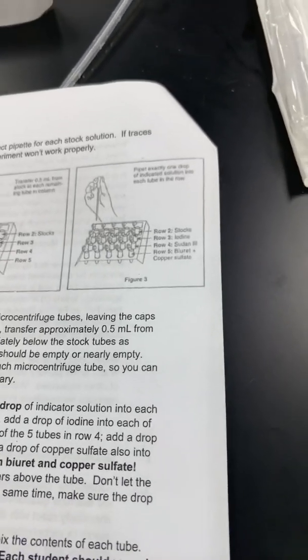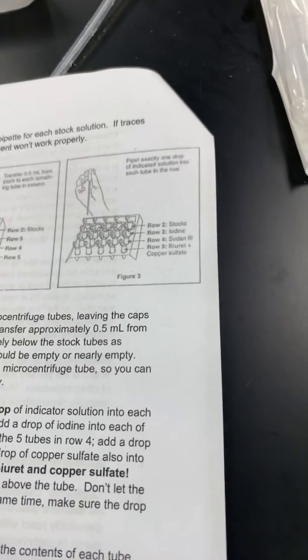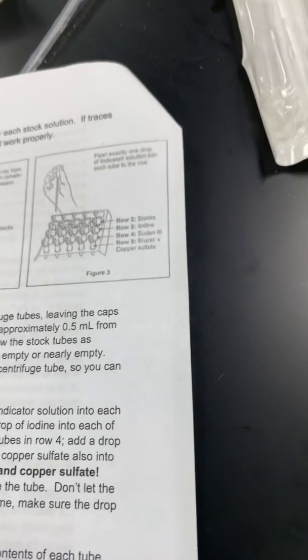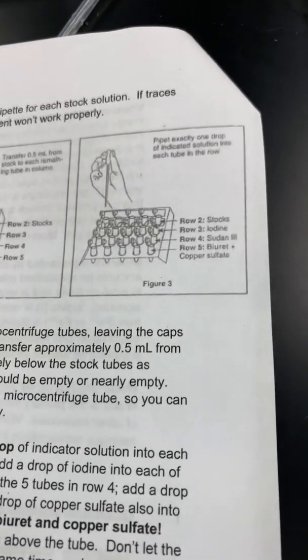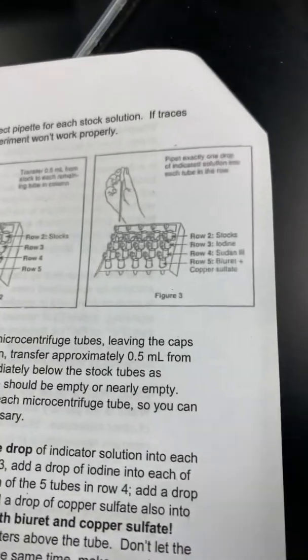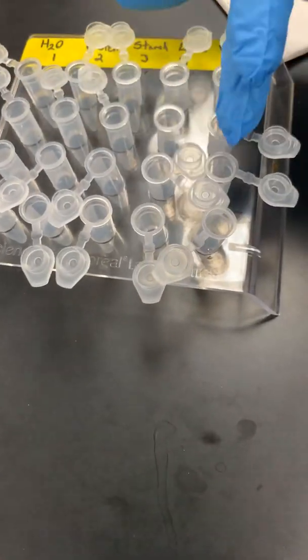Sometimes they can give you a quantitative analysis. So if you want to know, well, how much protein is there in this sample? How much protein is in this biological sample? Sometimes you can use these indicator solutions to do that, and we're going to do that with the quantitative analysis. We're going to replicate that, but for today, with the qualitative analysis, again, we're not getting exact numbers. We're just going to look at it, characterize the color changes. So to do that, we're going to add different indicator solutions to these different molecules. Again, you have test tubes with 5 different molecules going this way.